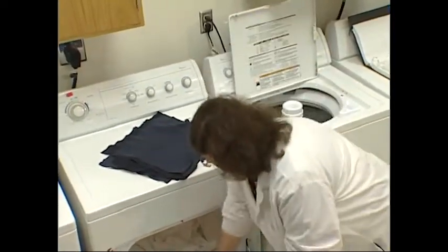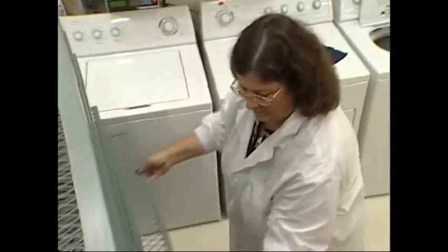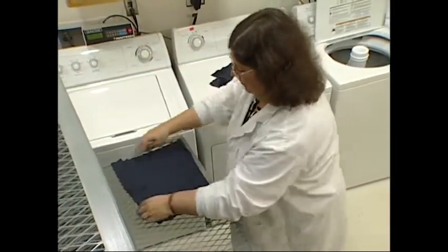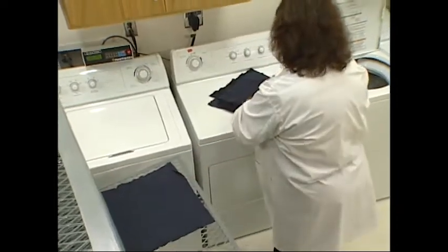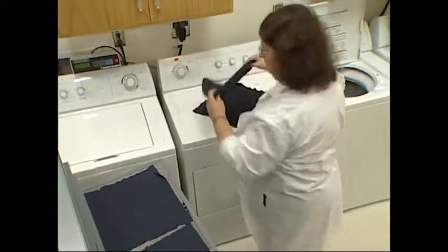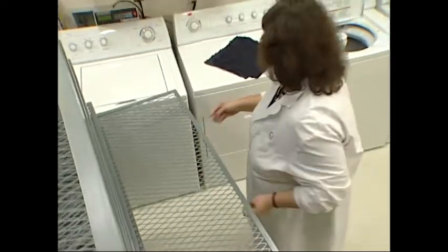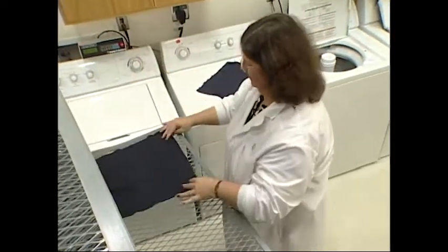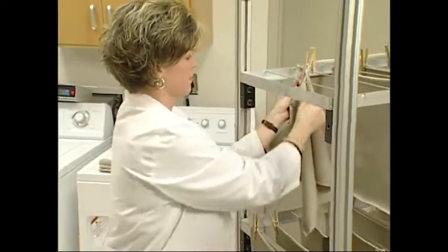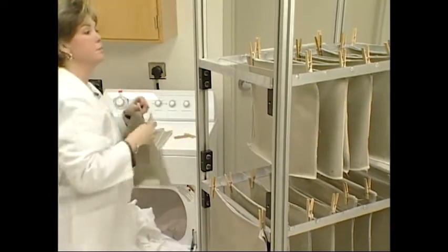One of the most important steps in measuring dimensional change is that of specimen handling following drying. Remove knitted specimens from the dryer after the final drying cycle and place flat on a conditioning rack shelf. Remember, knitted fabrics are easily distorted. If knits are hung prior to measuring dimensional change, they may elongate in length, thereby falsifying the data. Remove woven specimens from the dryer and hang on the clotheslines of a portable cart, with the length direction of each specimen vertical on the cart.